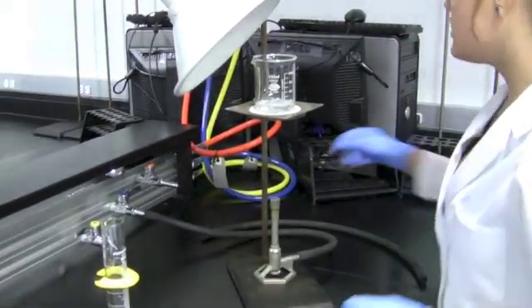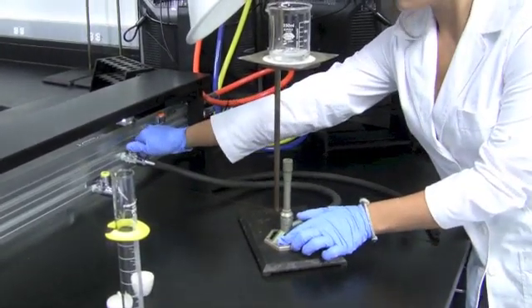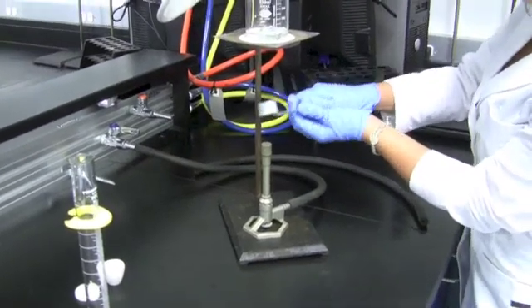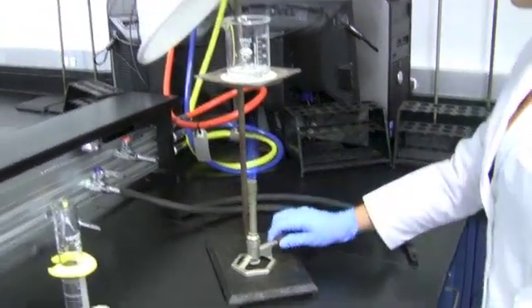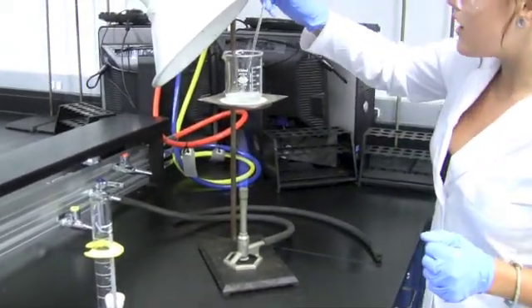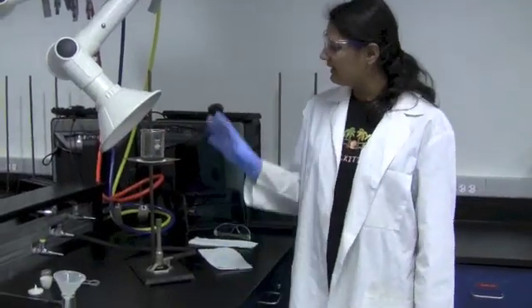We need to heat the solution, so I've hooked the hose up to the gas. You turn on the gas, and we're going to slowly heat the solution. Make sure that it's under the hood so that the hydrogen gas can get sucked up into the vacuum.